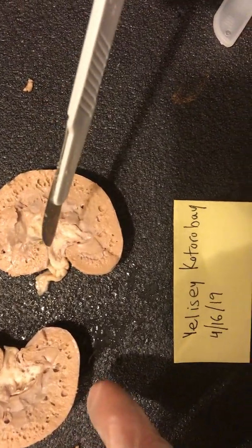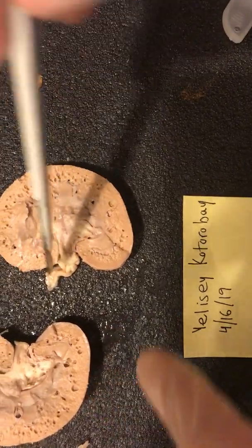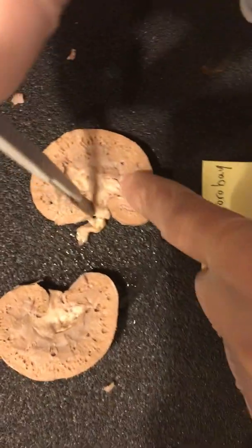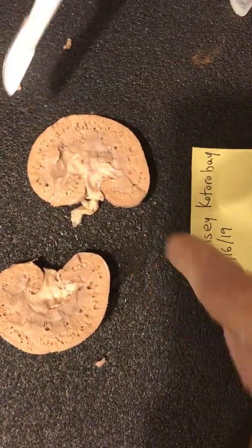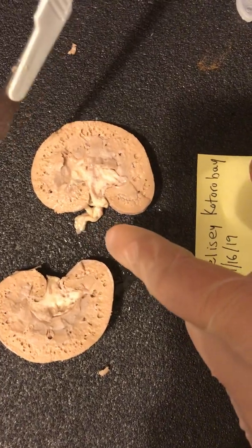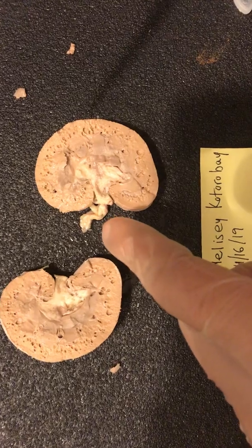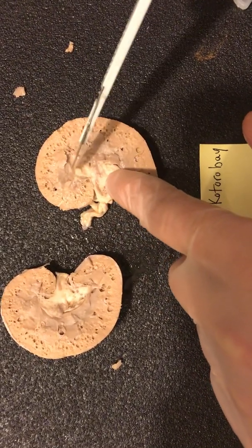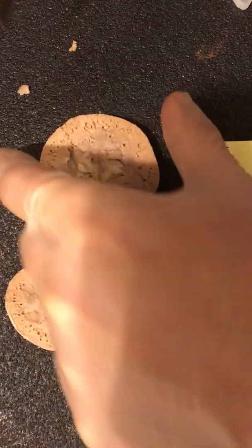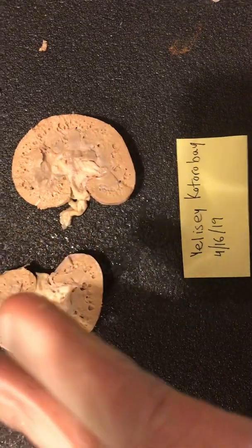You can't really see the circulation portion of the kidney too well because whoever prepared this kidney cut them really short, but normally they would come in through this section right here, so both the renal artery and the renal vein. Beyond that, we also have the major calyx and the minor calyx, and those are just the regions, the space right below that pyramid-shaped structure called the medulla. And that ultimately covers pretty much all of them.